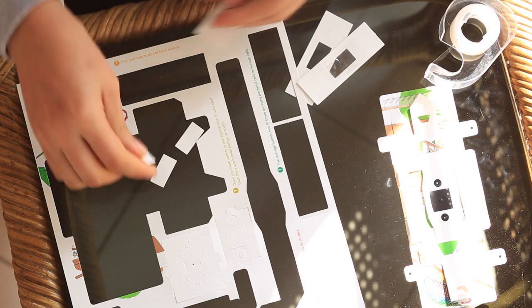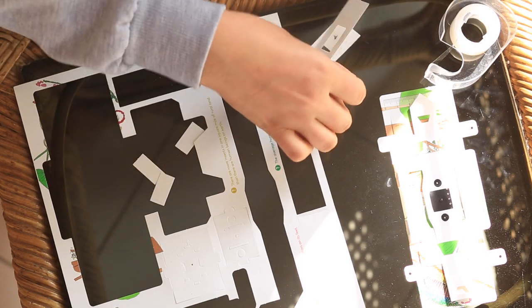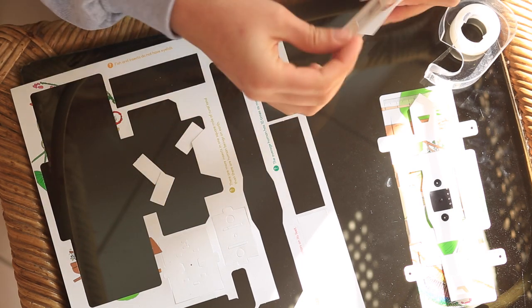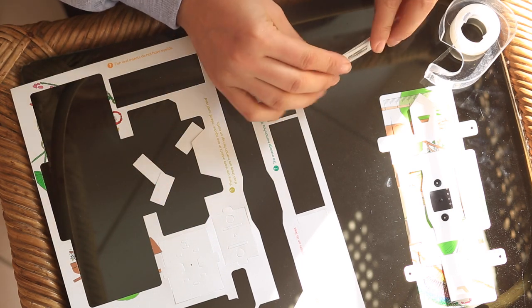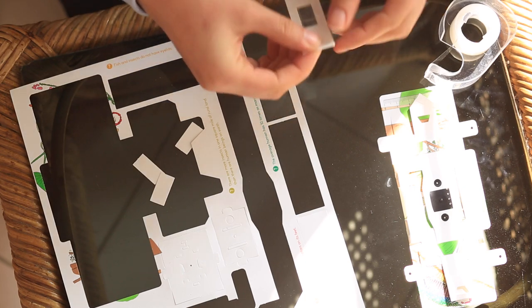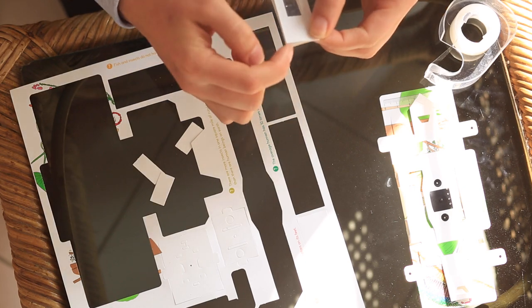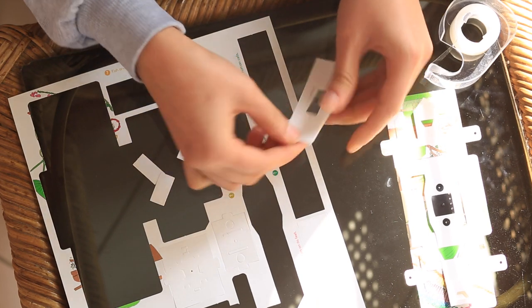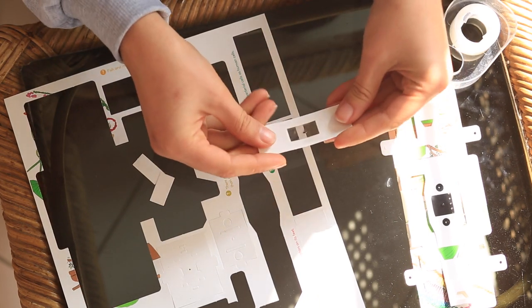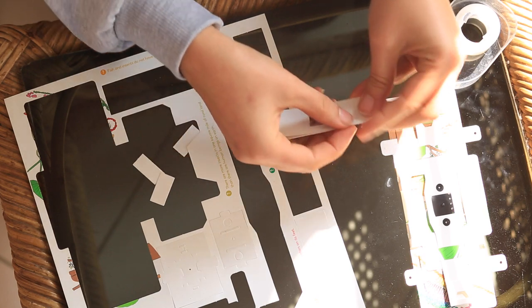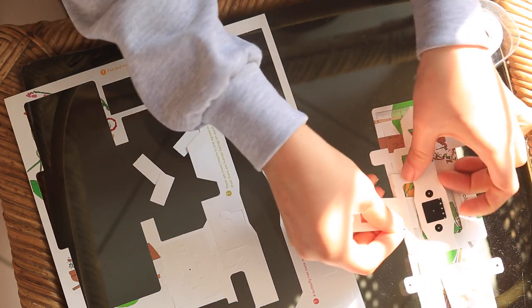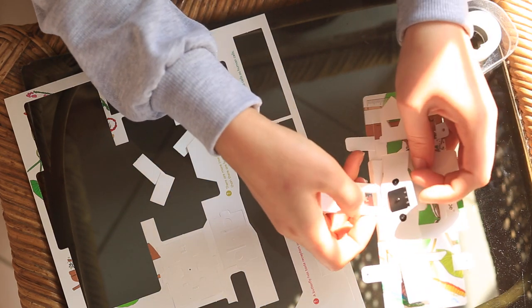You take two other slides. With all three slides. So three slides together is the same height as a glass slide. So you take all three slides and you put them inside of your Foldscope.